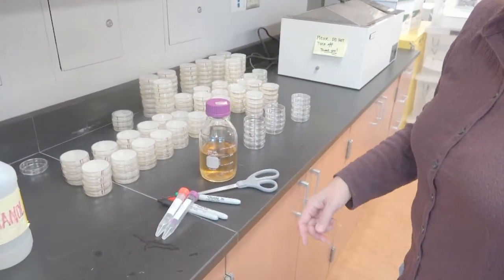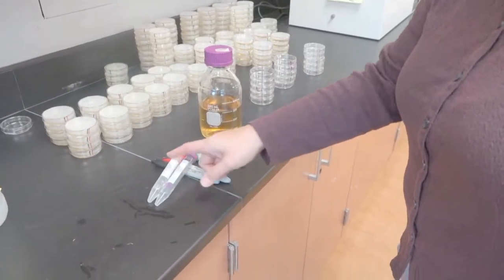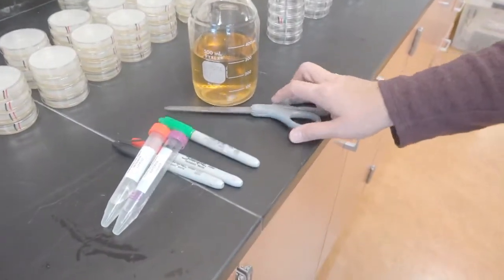This is 300 mils with 3 mils each of Ampicillin and Arabinose, as well as our three colored markers and scissors.